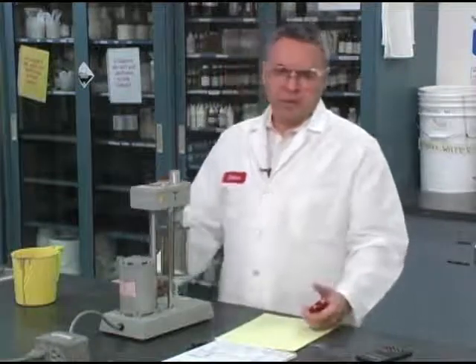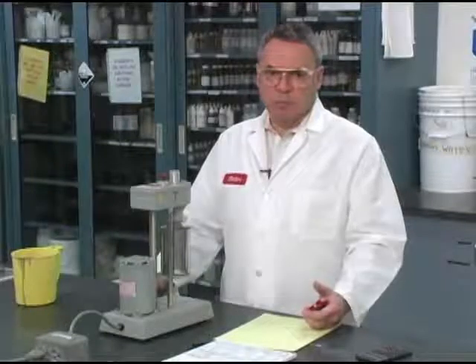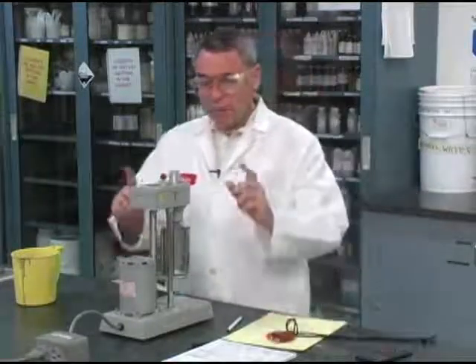The units are pounds per 100 square feet. What we are measuring with this dial is a measurement of shear stress in units of pounds per 100 square feet. Now I want to do the same, but now we are going to measure 10 minutes.